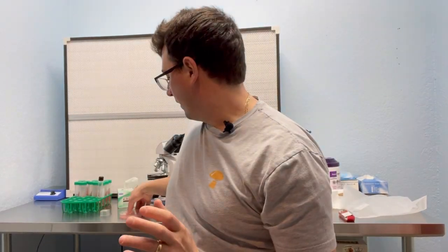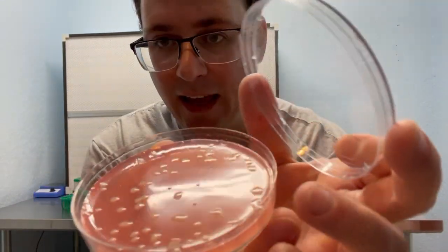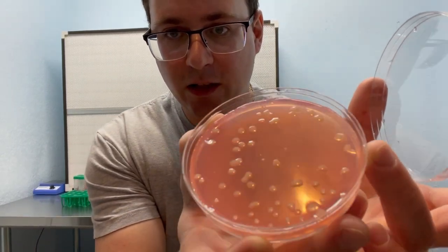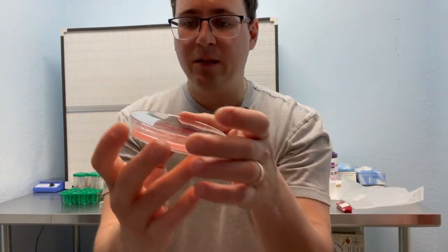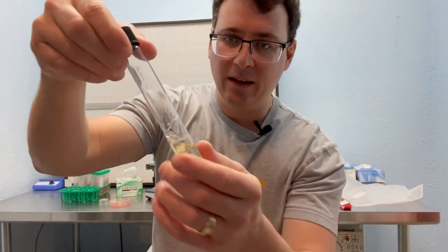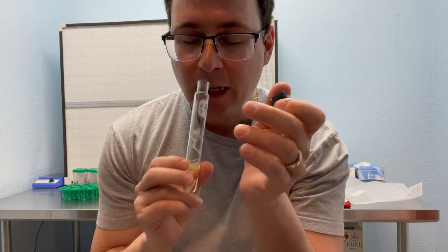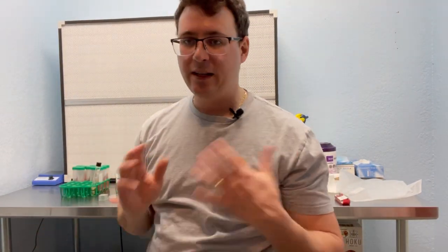So I went ahead and plated the yeast contaminant out on a malt extract agar. And you can see it has a creamy texture to it, kind of circular colonies. And notably, it smells like bread or beer, which was definitely a giveaway when I was making this liquid culture, or when I was making the slide. I instantly smelled that brewer smell, and that was a dead giveaway that there was yeast in this liquid culture.